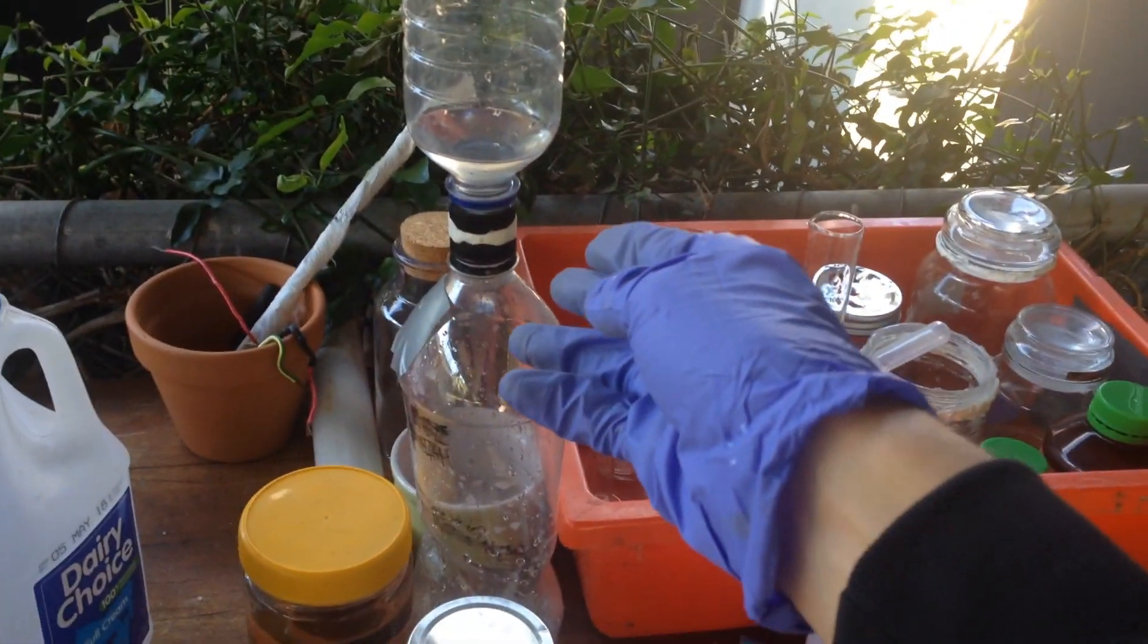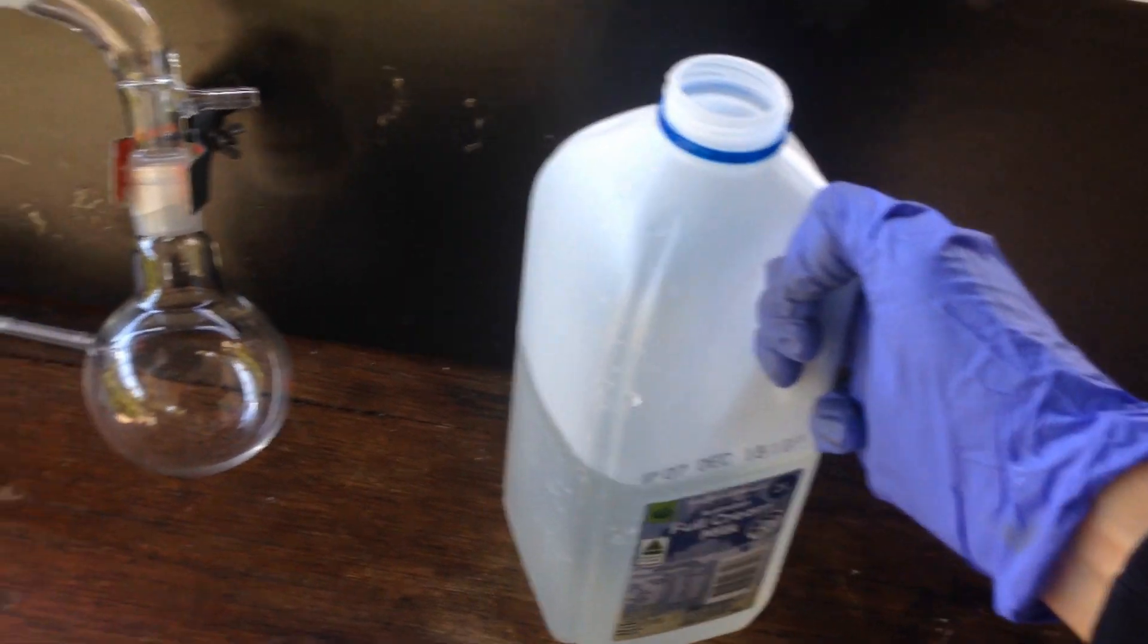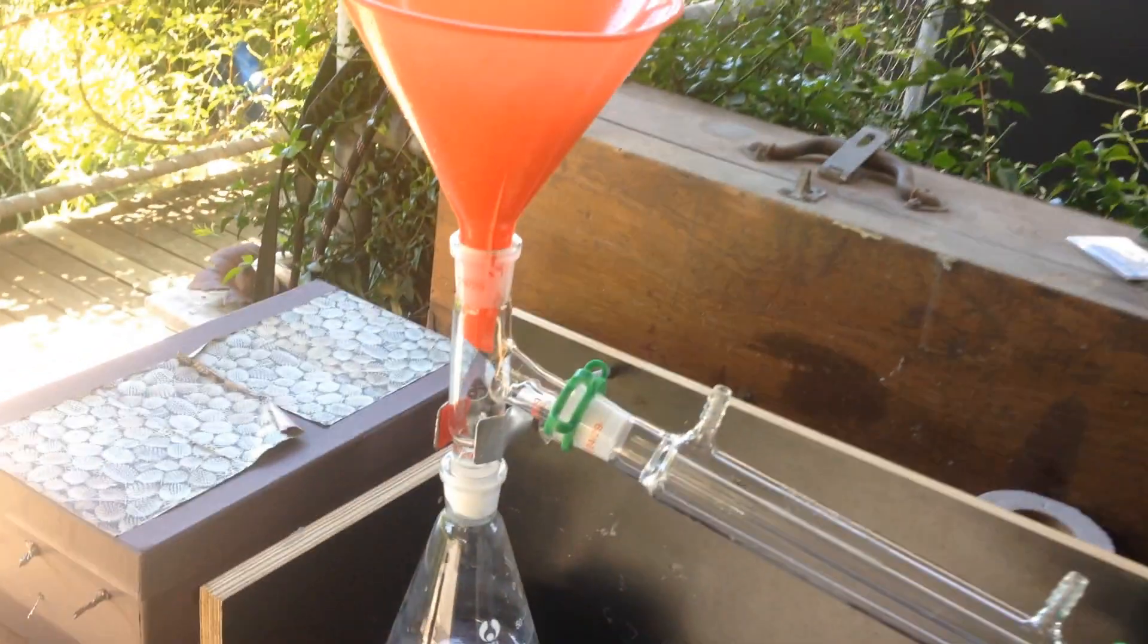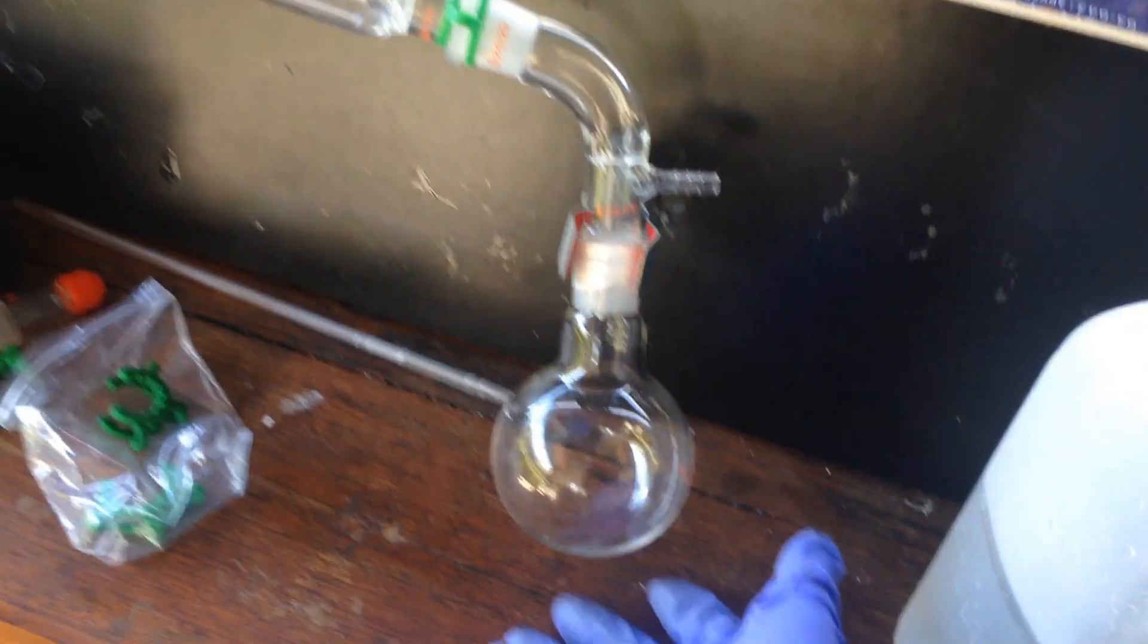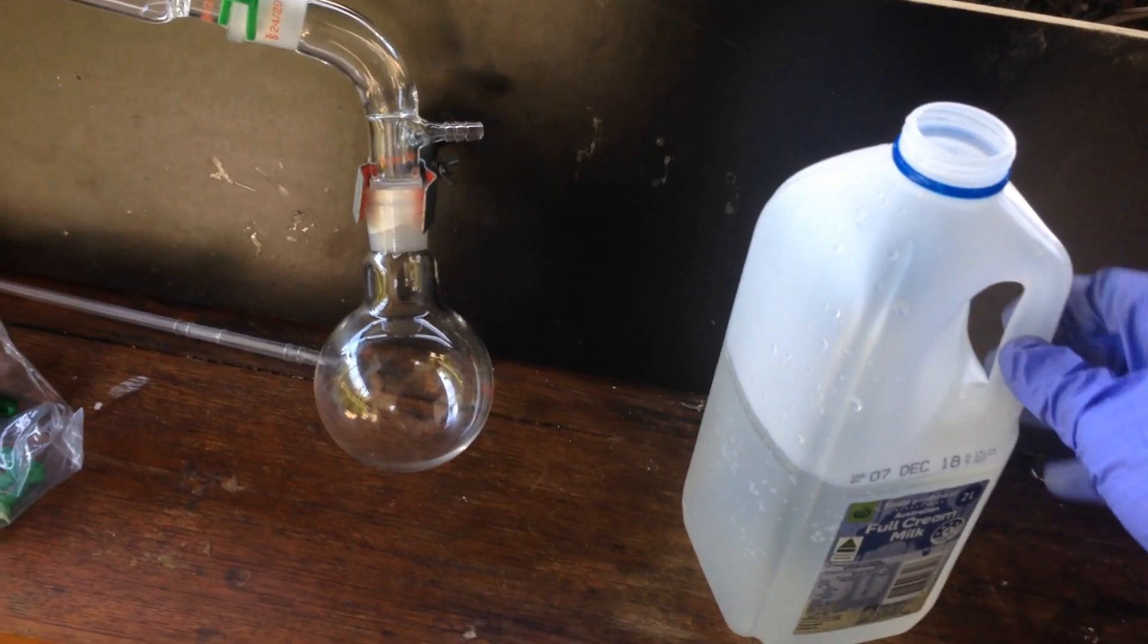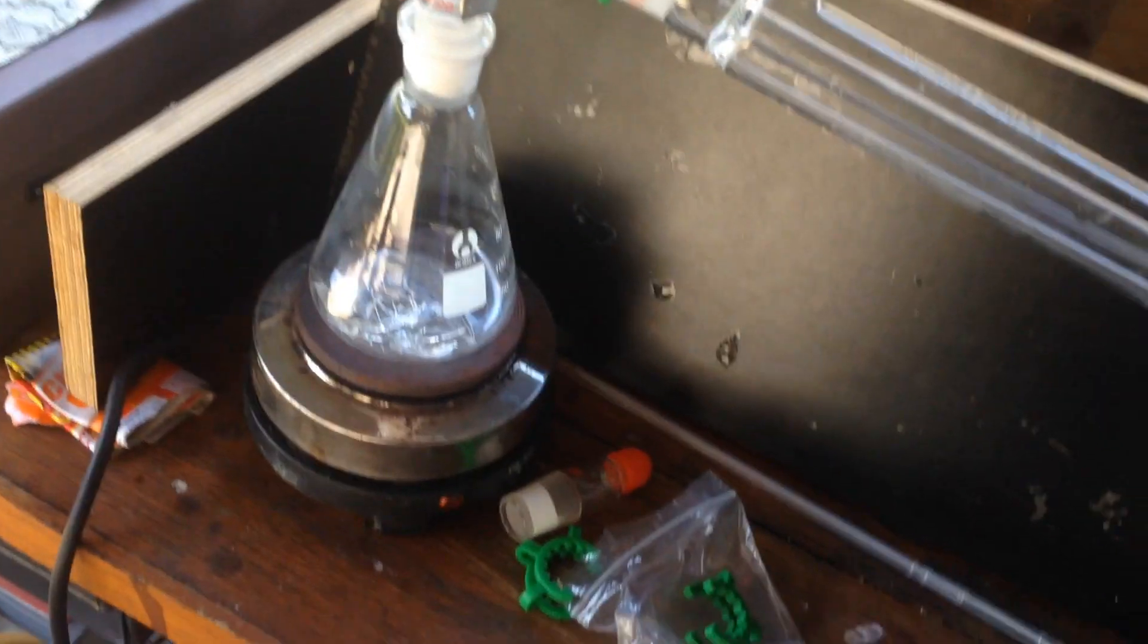I've still got a little bit more filtering just over here, but for now, we can just add some of this to the distillation apparatus, and when we distill it over, we should get our pure water with a high concentration of deuterium, and we should leave behind our sodium sulfate.